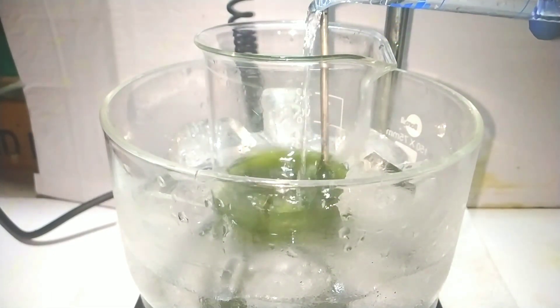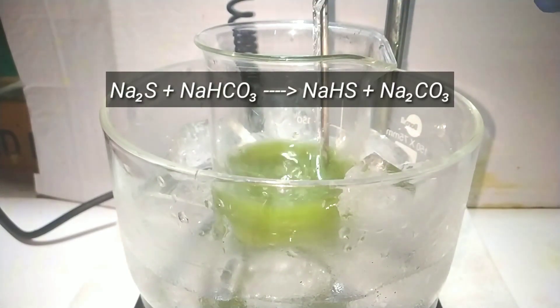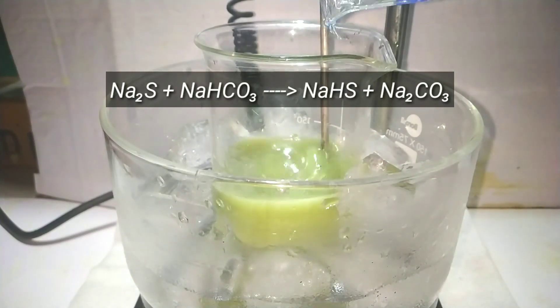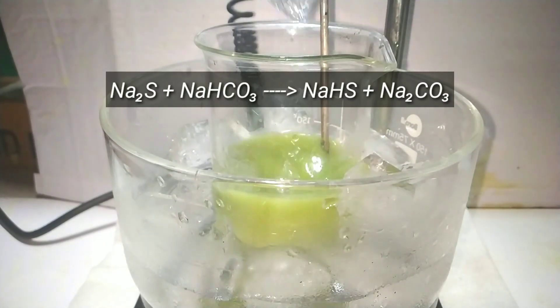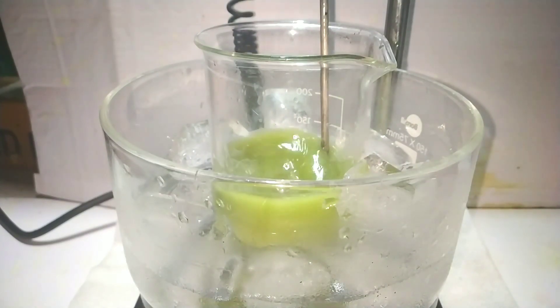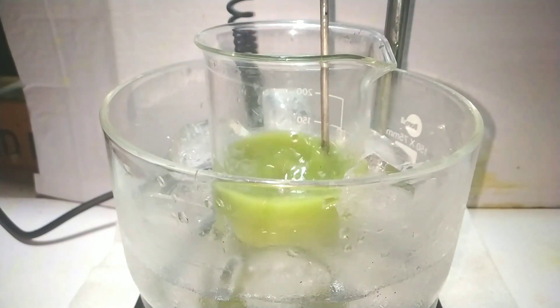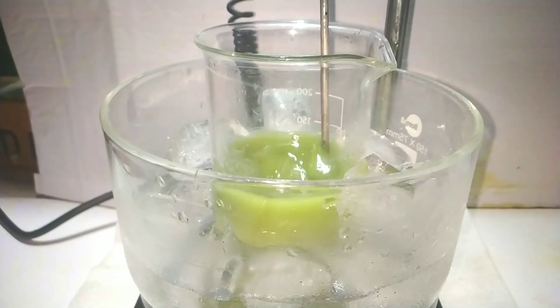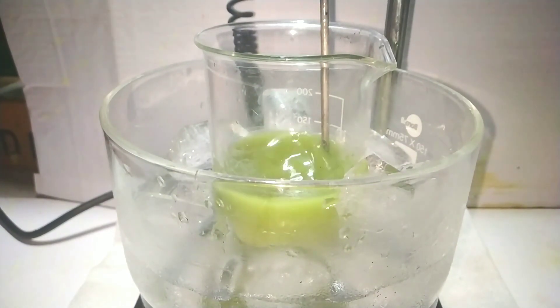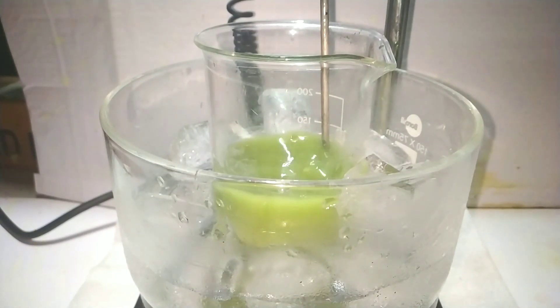Let me explain what happened until now. When sodium sulphide and sodium hydrogen carbonate combine together, it forms sodium hydrogen sulphide and sodium carbonate — a kind of double displacement reaction. But the sodium carbonate will remain in solution along with sodium hydrogen sulphide. When we add the organic solvent methanol, sodium carbonate becomes less soluble and separates out as a precipitate. This can be filtered off and we will be left with relatively pure sodium hydrogen sulphide solution.